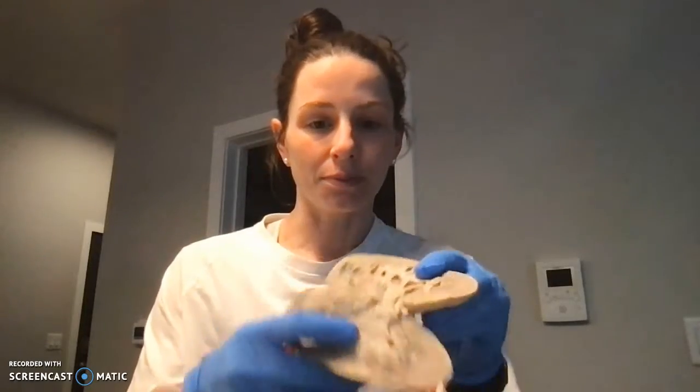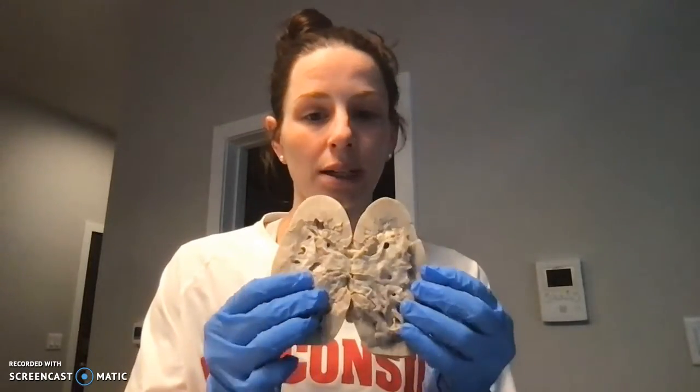Every time I've taken anatomy, I guess a couple times now, and every time learning about the kidneys, just everything that's happening at that level where the urine is being made and filtered and the ions are getting absorbed or end up being secreted by the body, that this is all happening. Sorry, I was holding my kidney up. And this small structure is just really fascinating to me.